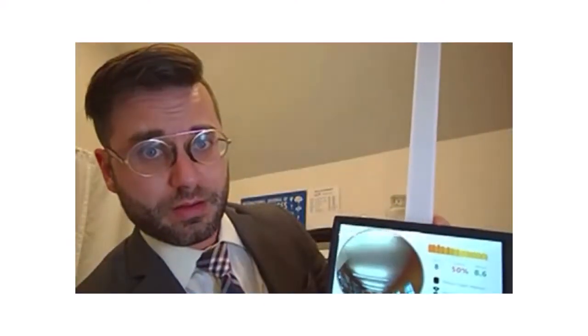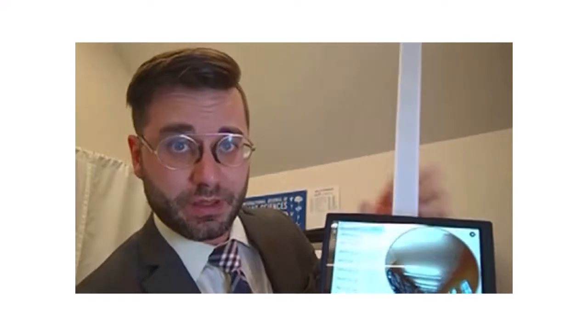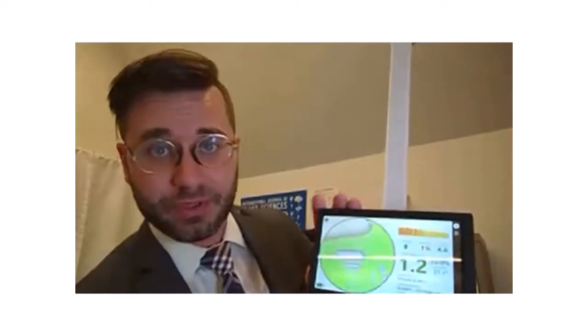Once you take a picture and release the trigger, it then does the calculations and saves that data for you. And then you can go back and view both the video picture and the digital version with all of the current thresholding levels. So that is the basic way that this works.